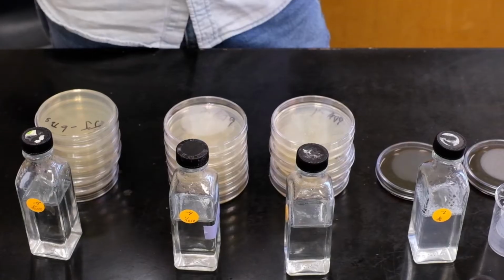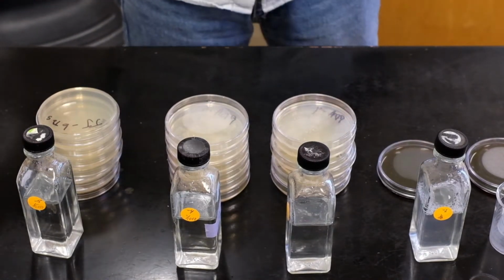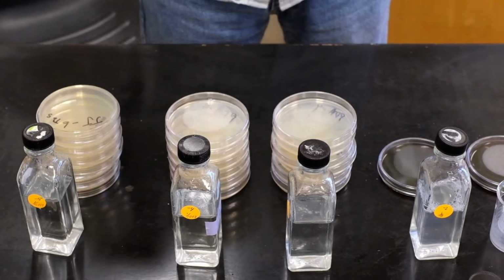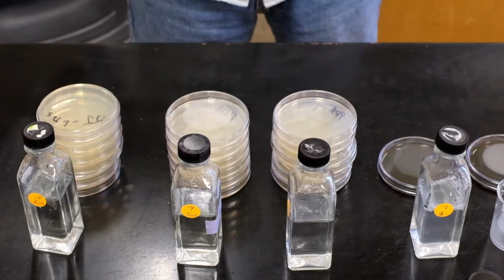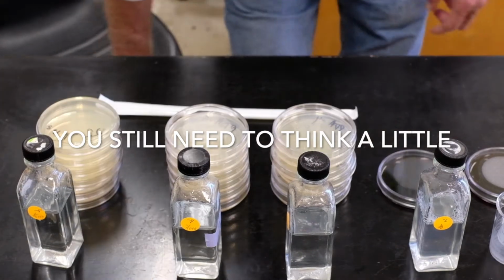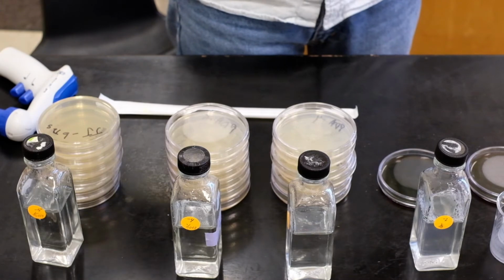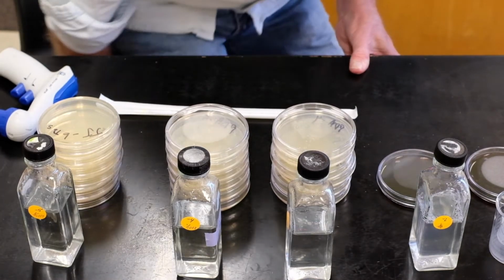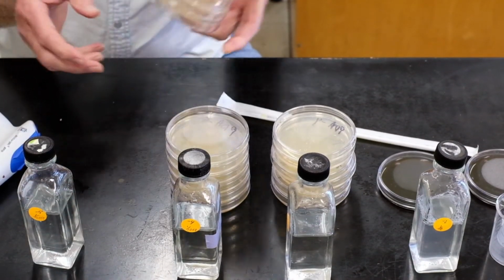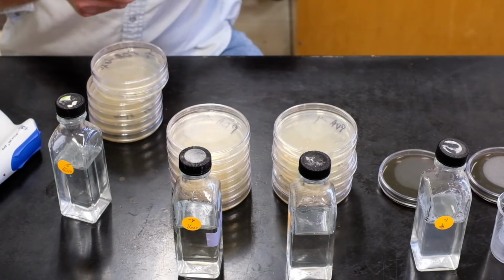One thing before I start pipetting: to keep from making mistakes, you prepare all your dilutions and label all your plates before you even start, so you don't have to think about what you're doing. So what I'm going to do now is plate the -6s. We're going to turn this over.